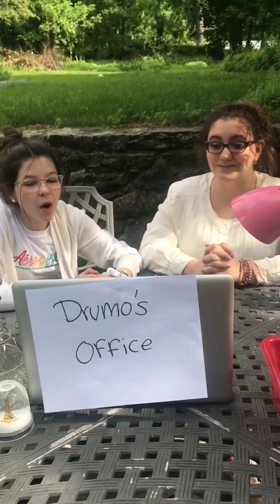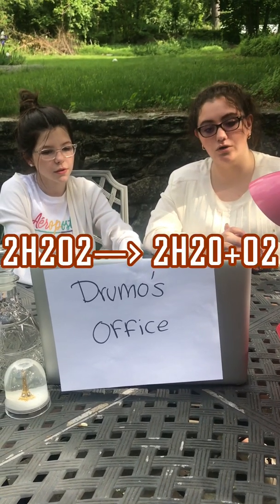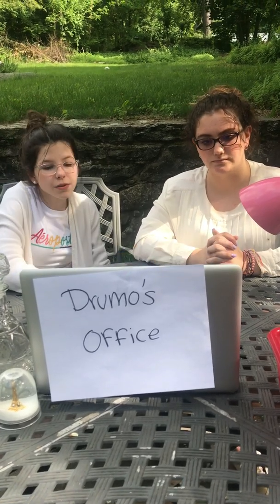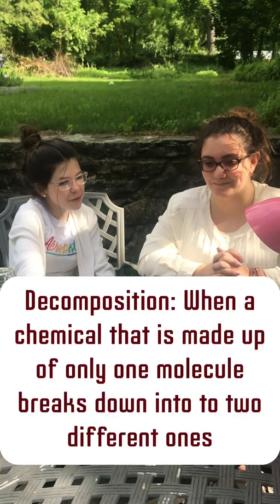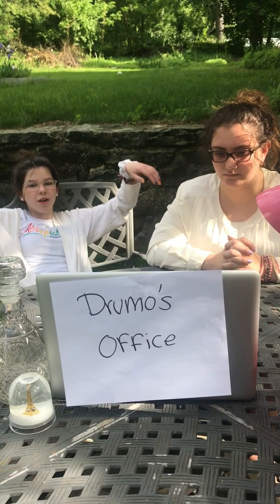Here is the simple formula for the reaction we are about to witness. It is 2H2O2 yields 2H2O plus O2. We notice that this is a decomposition reaction, Mr. Blessington, when a chemical that is made up of only one molecule breaks down to two different smaller molecules.